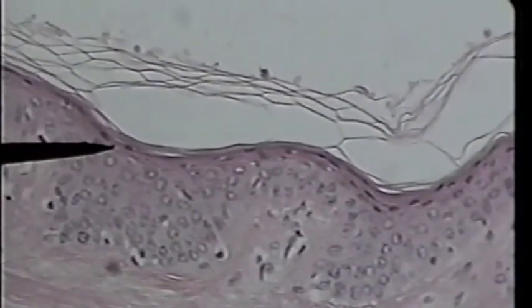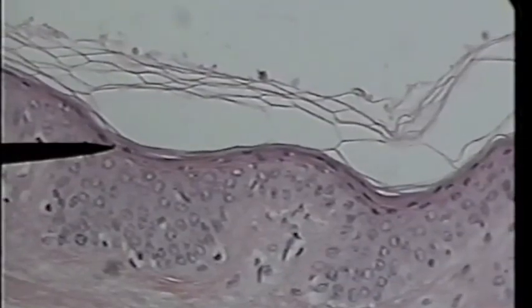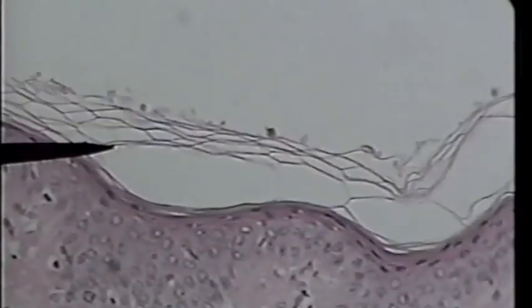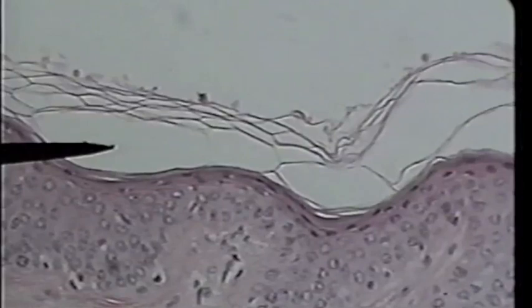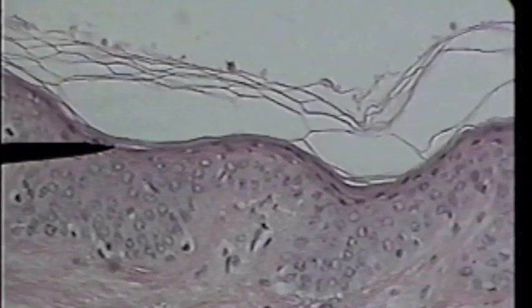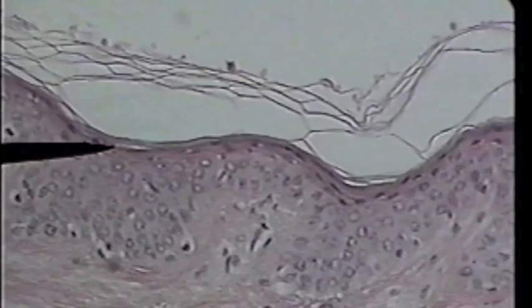The underlying tissue is different. The epithelial layer extends from here through the living cells, and you can see the non-living cells superficial up here — they are actually dead cells. This is the keratinized layer that has artificially been uplifted from the tissue when the slide was prepared. Note how much thinner the keratinized layer is on thin skin than thick skin.